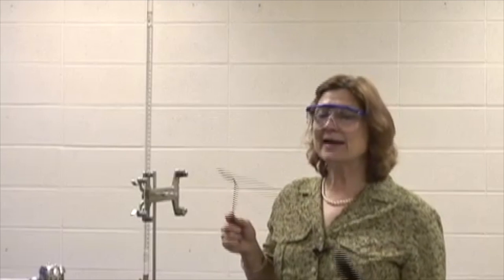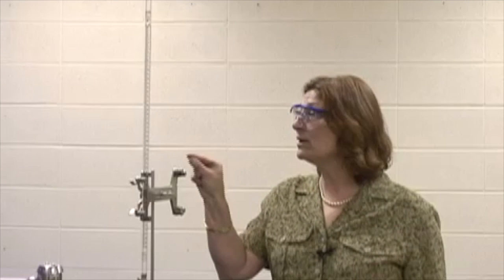Here we are on day 1 of the titration lab. Now we're very fortunate because we did not have to clean out the burette and make sure that it was ready to go. What would need to be done is that we have a burette brush that would wash the burette. We would wash it with soap and water and then rinse it with distilled water, and then it would be necessary to use a small amount of our base, or whichever liquid we were putting in the burette, to rinse it, because any water that would be left would change the concentration. And we want to make sure that we are determining the concentration of our prepared solution.